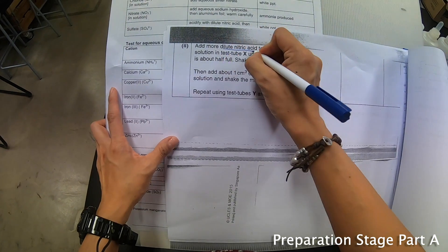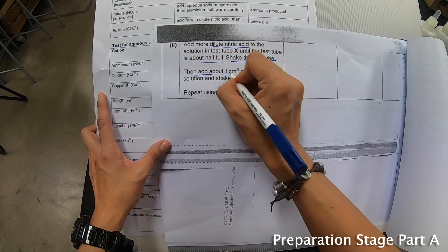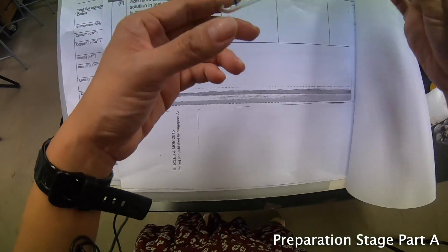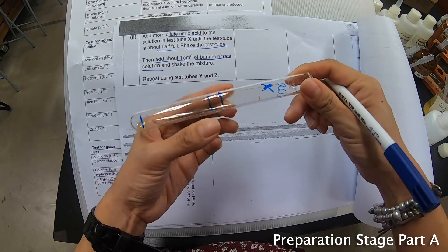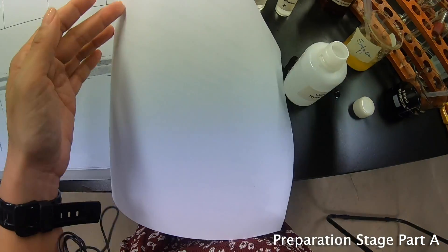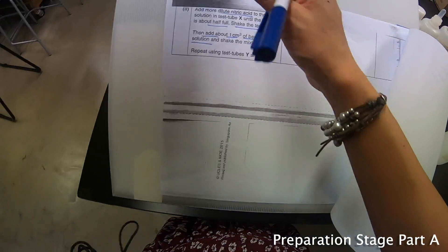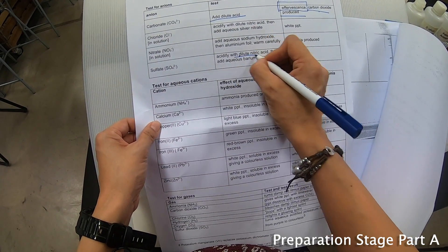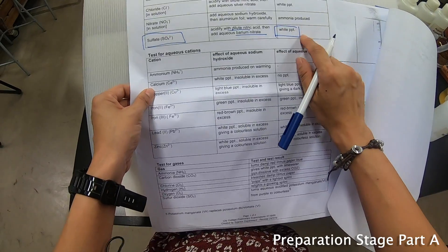Add more dilute nitric acid to the solution in test tube X until the test tube is about half full, and shake the test tube. Then add about 1 cm³ of barium nitrate solution. According to the QA notes, adding nitric acid followed by barium nitrate is a test for sulfate — if a white precipitate is formed. So I have to look for white precipitate.